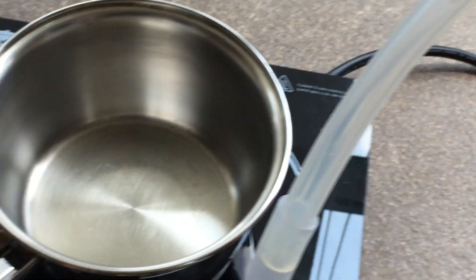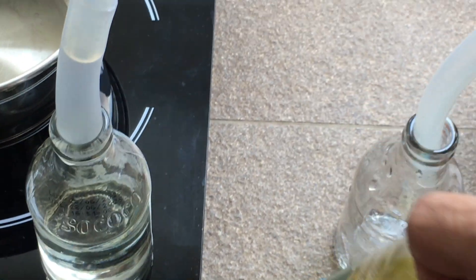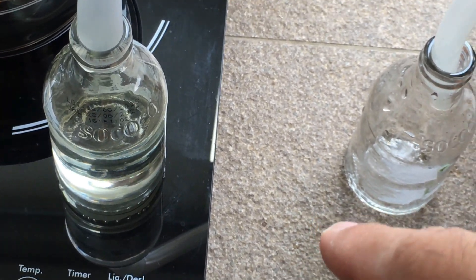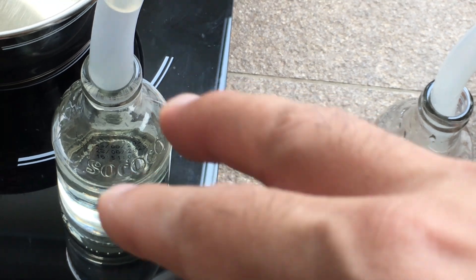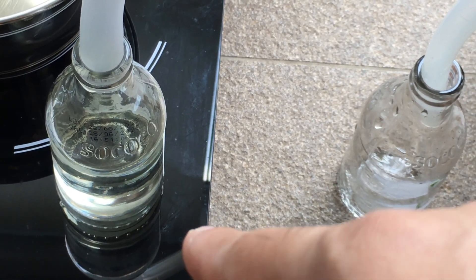I'm going to use an oil bath. Since the bottom is concave and it's not a flat surface, it'll take a while to heat up, so an oil bath is the way to go. I don't want this to be a rolling boil — just around 77 degrees Celsius.